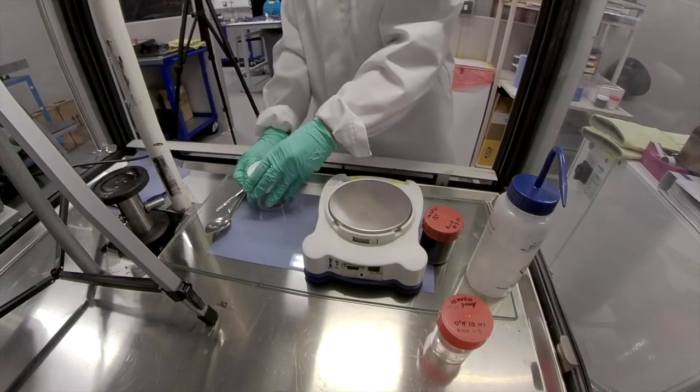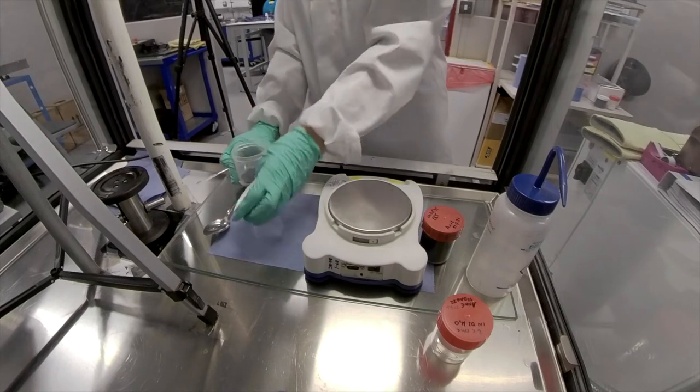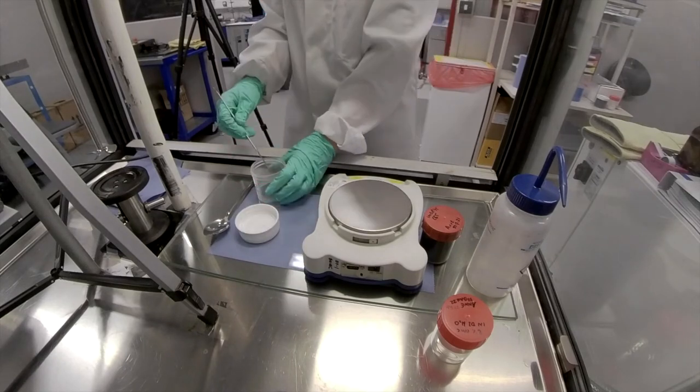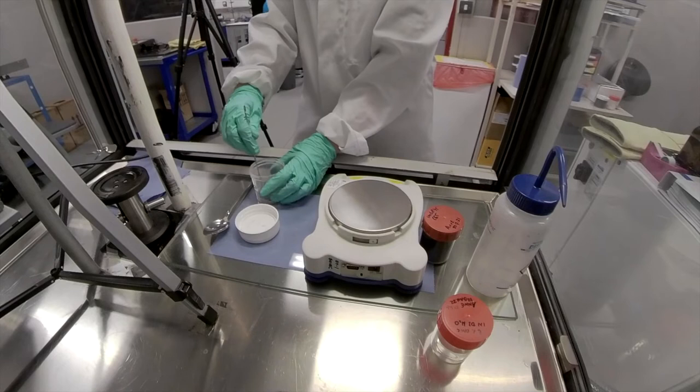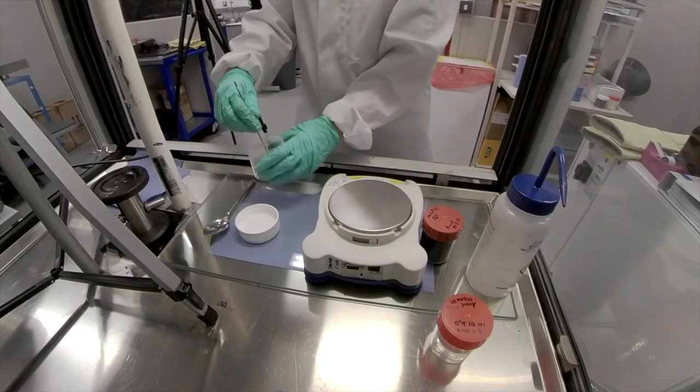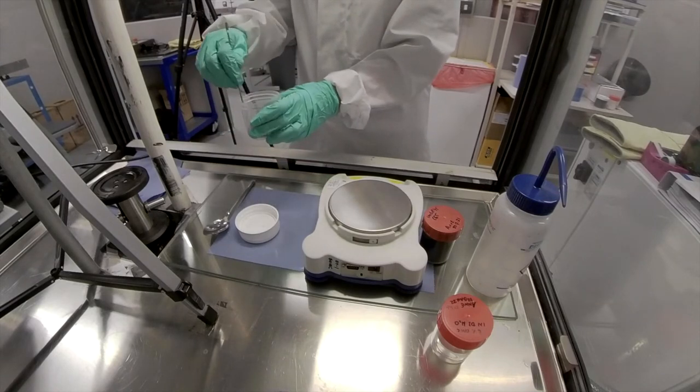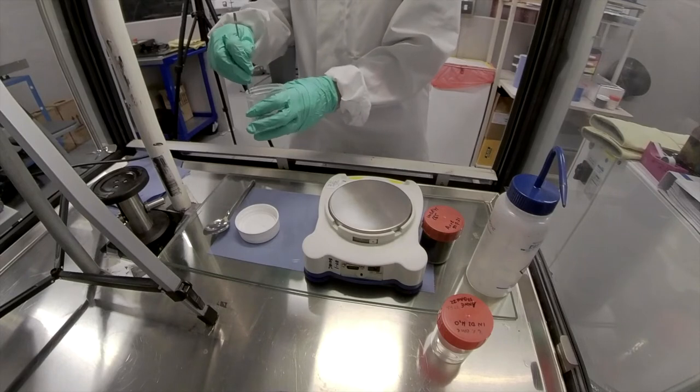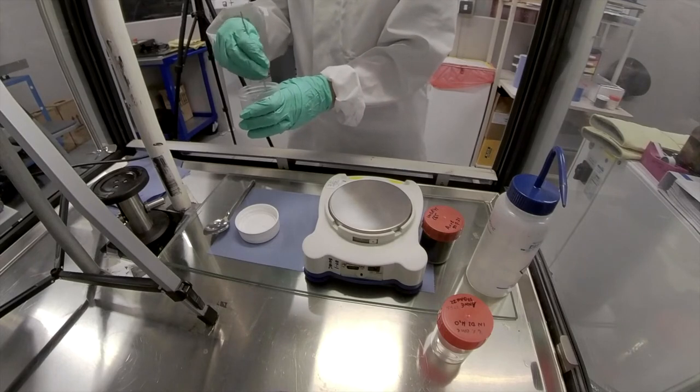And once I've stirred in enough of that carbon black that I can't see any of the dry material on the surface, then I have more confidence it won't escape the cup when I start the mixing.